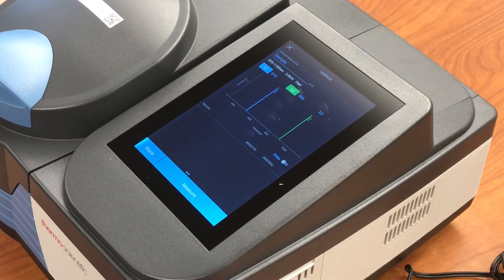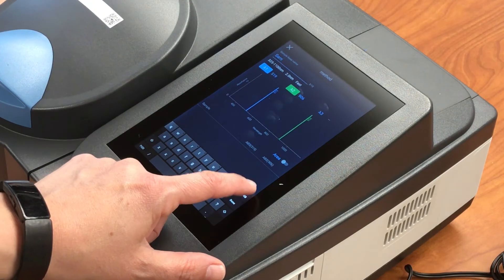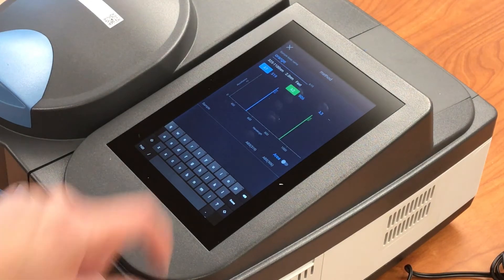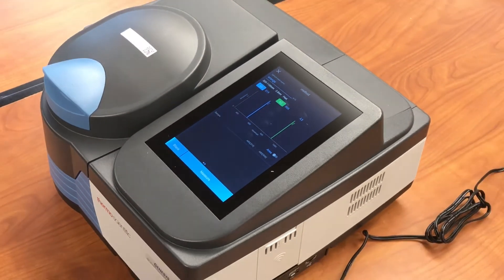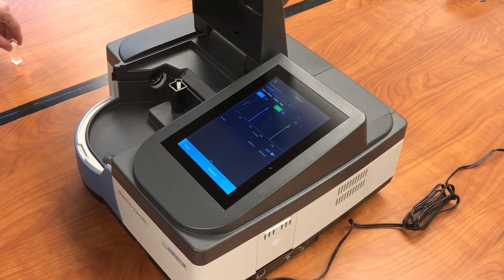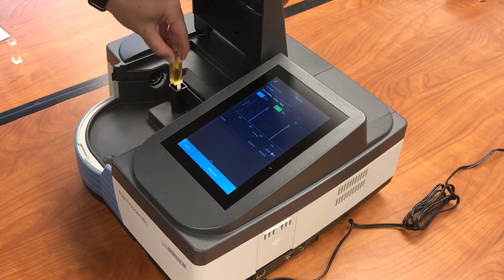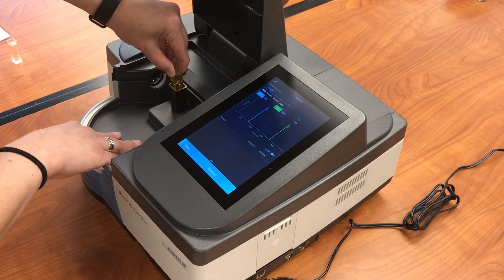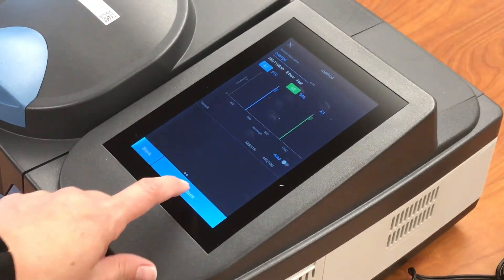Now we can measure the absorbance of a sample. If you wanted to be specific on the name here, we're going to measure a solution that is orange, so we could put that name in there. We can remove the blank, input our sample — this is our orange sample — close the lid, and then we can touch measure.